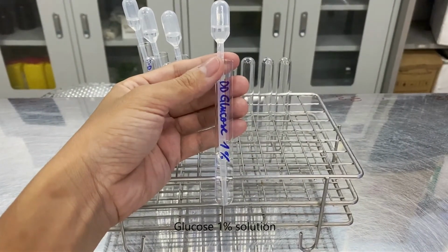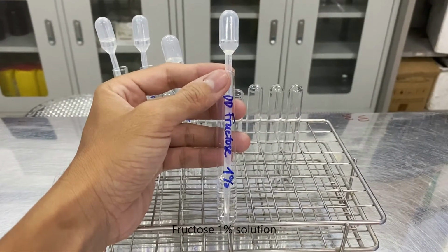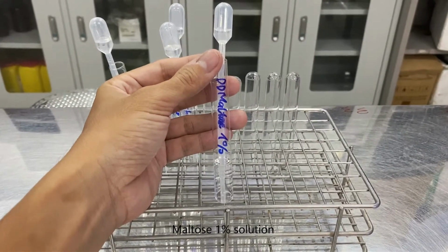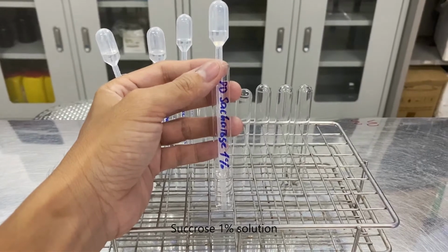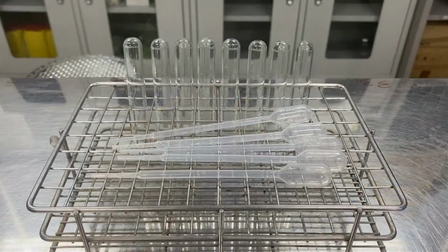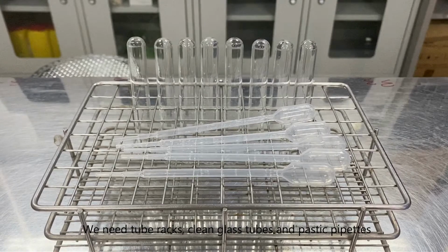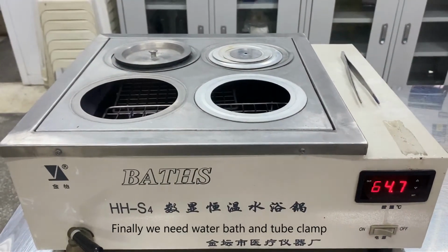Glucose 1% solution. Fructose 1% solution. Maltose 1% solution. Sucrose 1% solution. And starch 1% solution. We need tube racks, clean glass tubes, and plastic pipettes. Finally, we need a water bath and tube clamp.